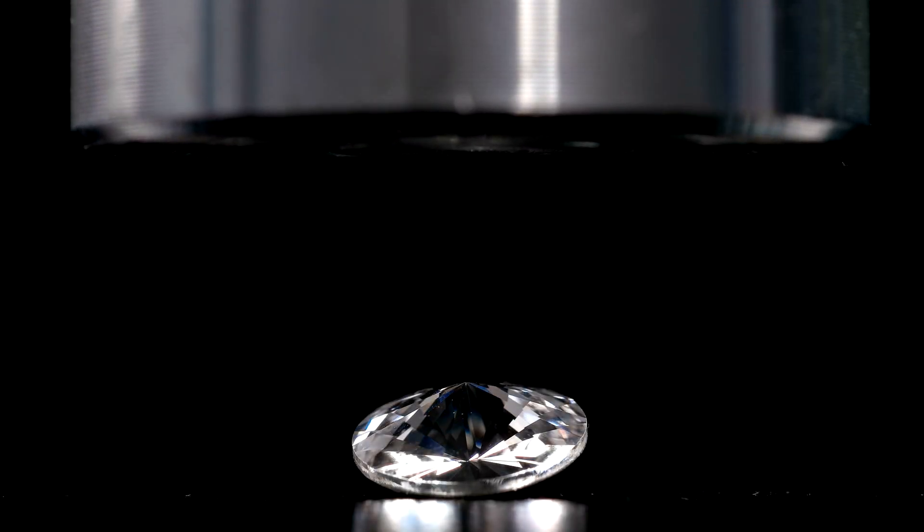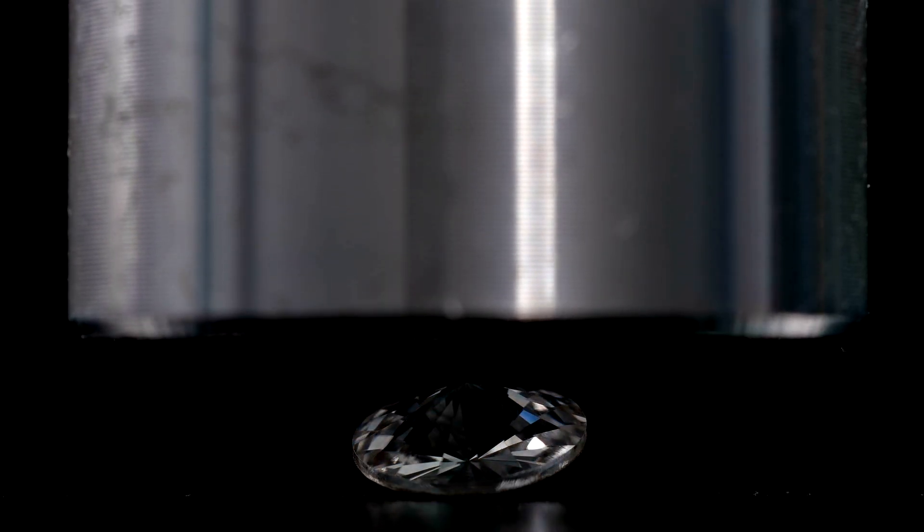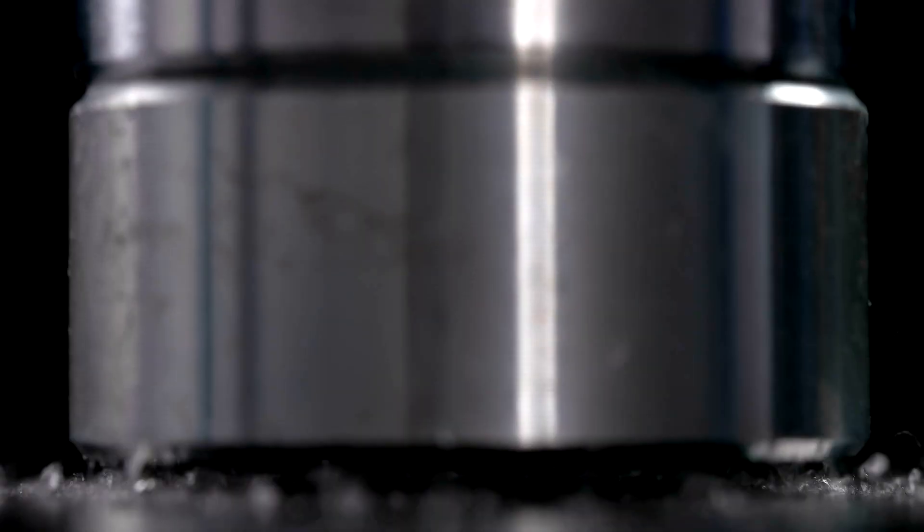Although a diamond is hard, it is still brittle. If sufficient force is applied, even a diamond will shatter. Now that we are more familiar with the properties of nonmetals, let's examine two common nonmetal gases, hydrogen and oxygen.